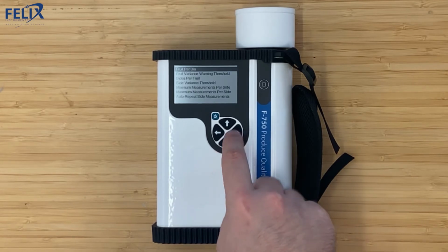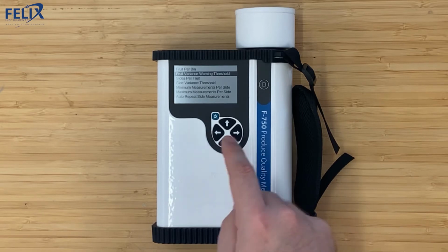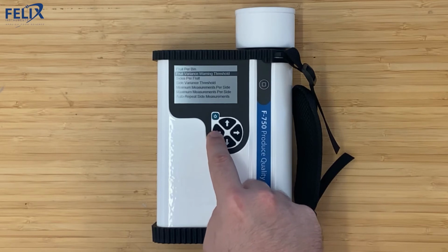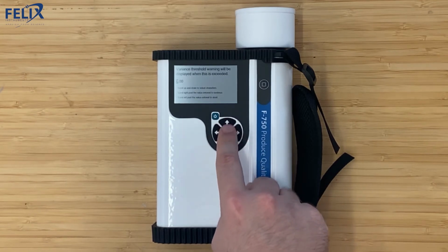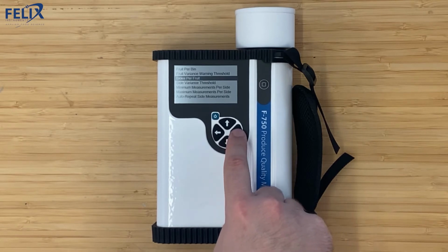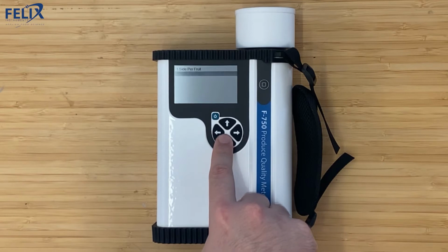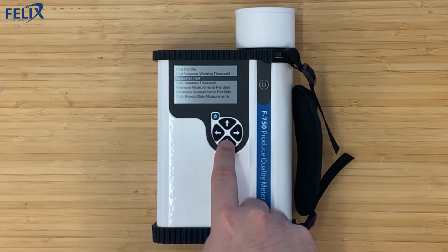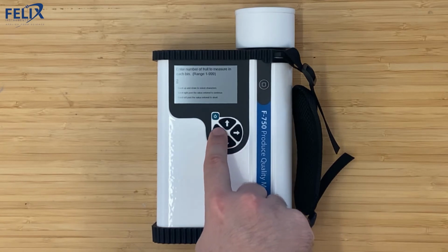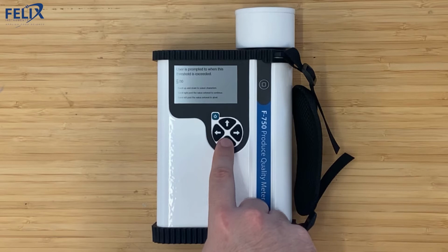And this is where you can edit things like the number of fruit per bin, the fruit variance warning threshold, which you can change here, the sides per fruit. So we're going to change the fruit variance threshold to 1% standard deviation. We can change the number of sides per fruit that we're scanning. We're going to make that 2 sides per fruit. And you can also change the number of fruit per bin, which is set at 5 right now. We'll leave it there. And then you can also change the side variance threshold. So we'll change that down to 1.